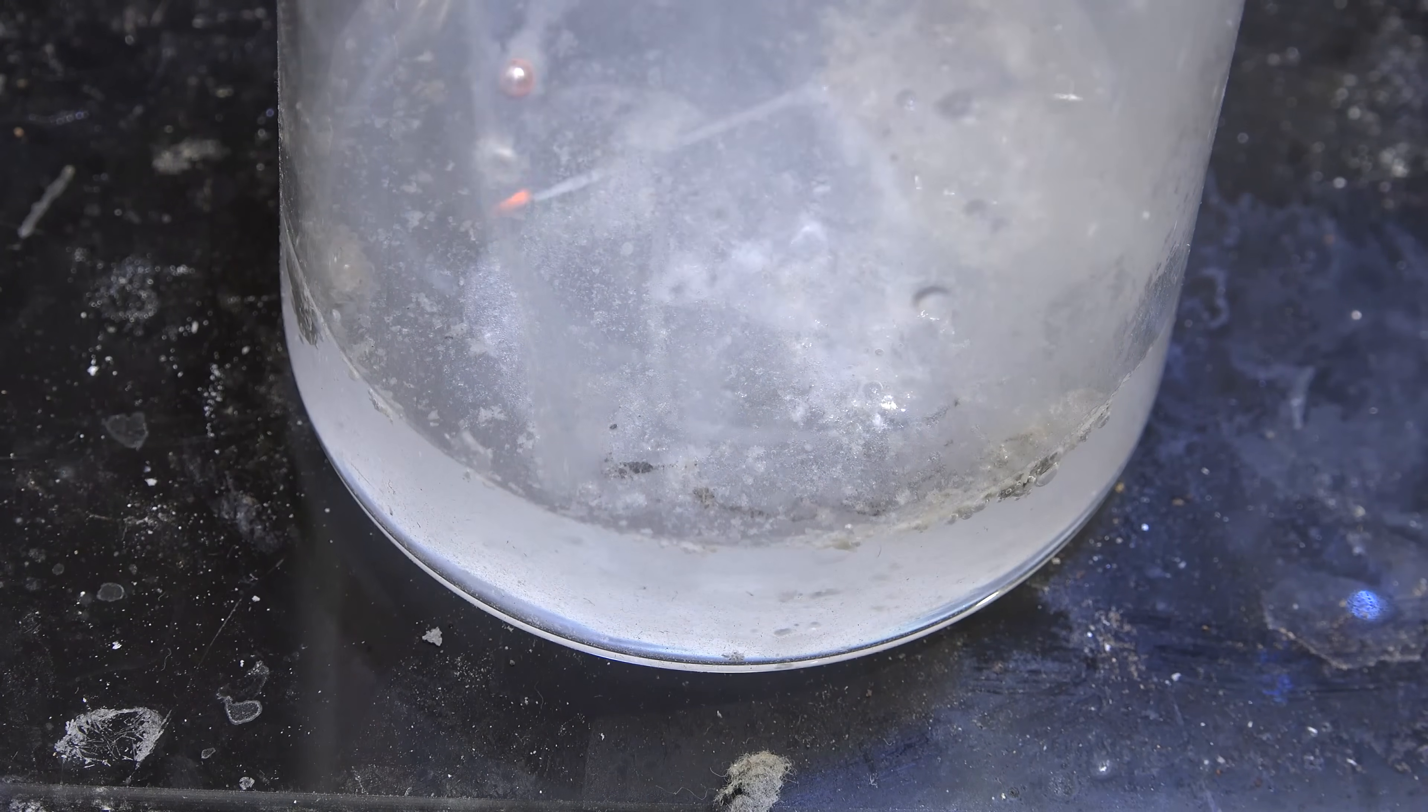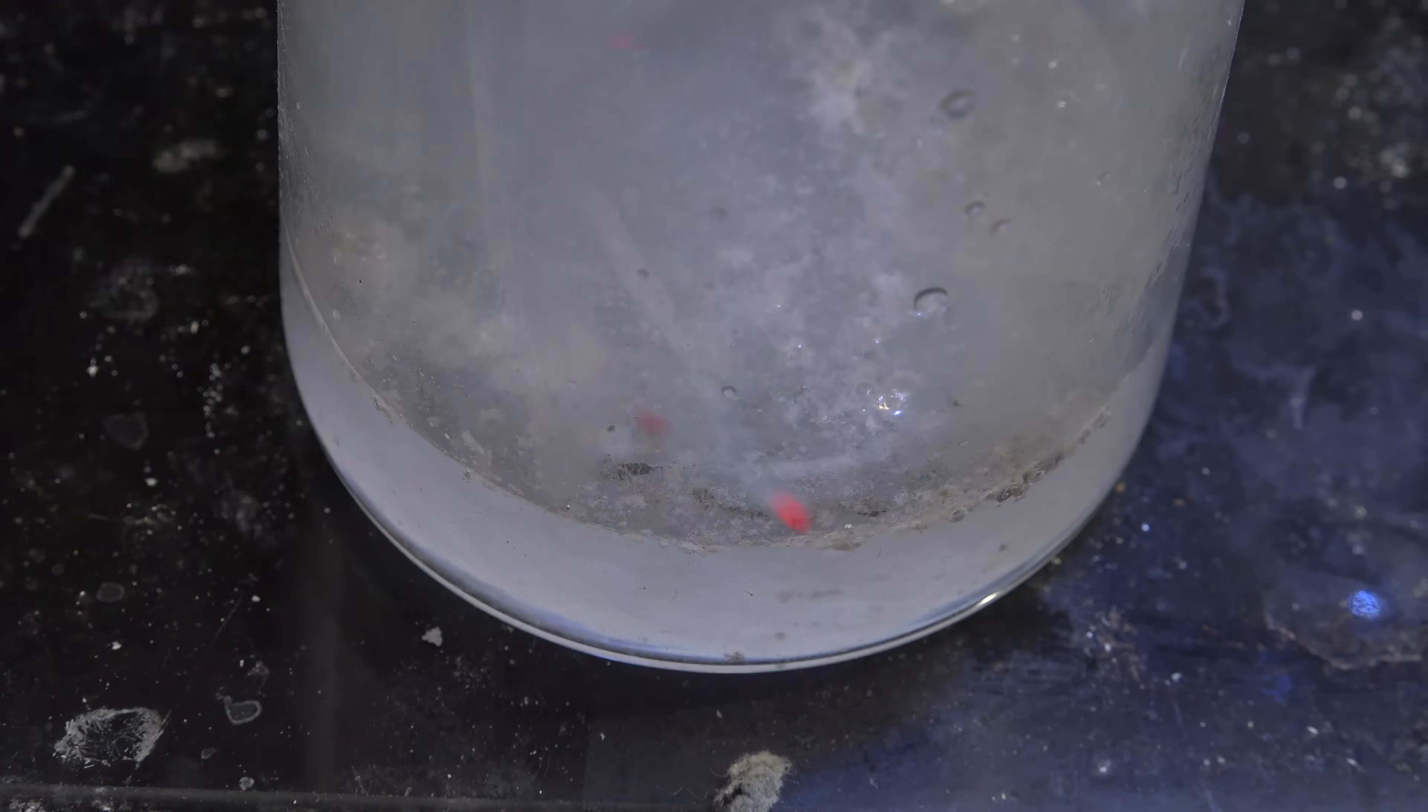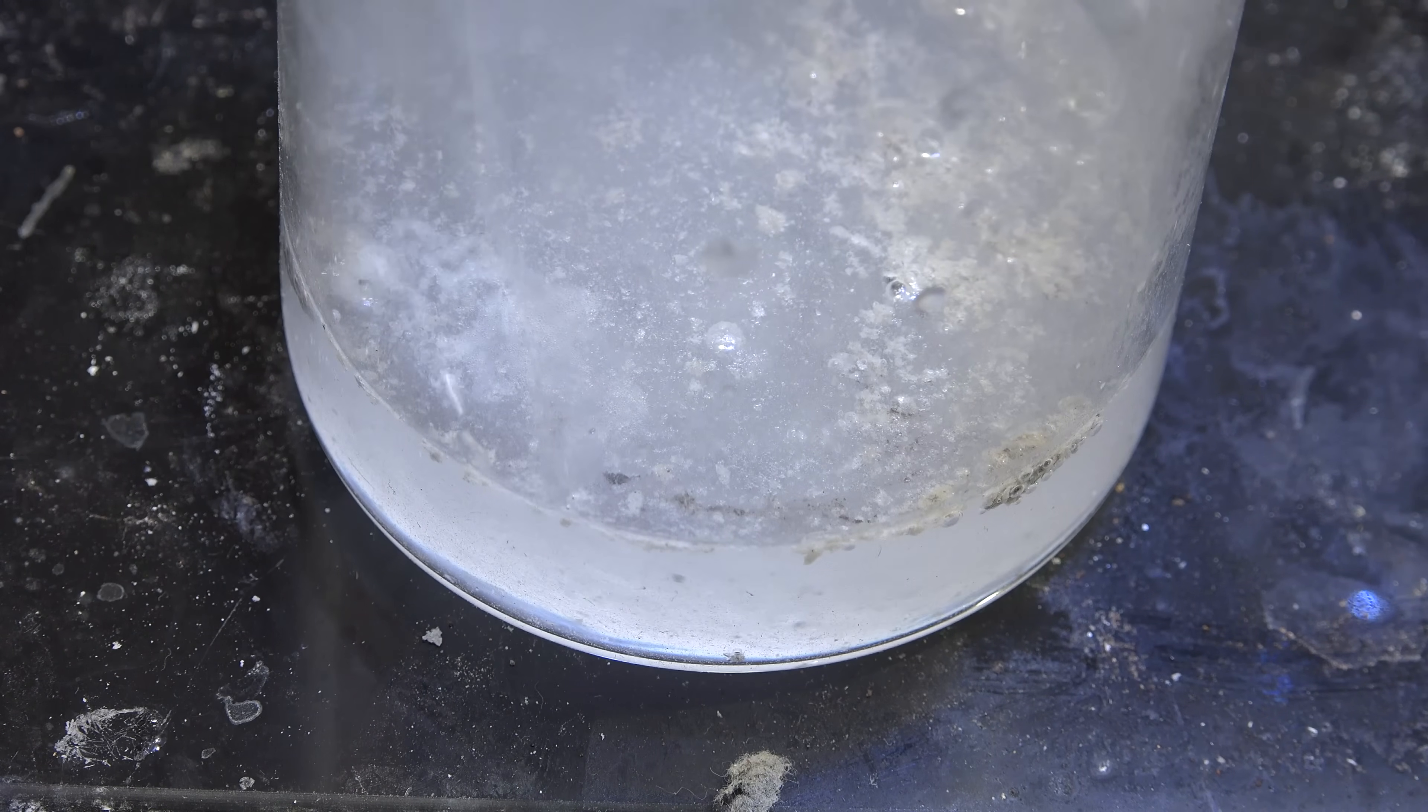To test it I scooped out the sample and put it in water. That is definitely sodium metal. So this process works.